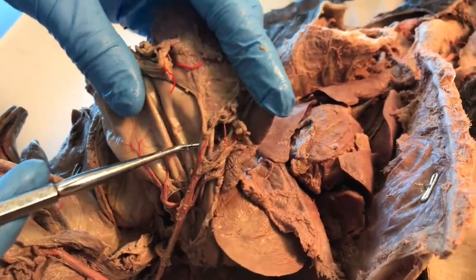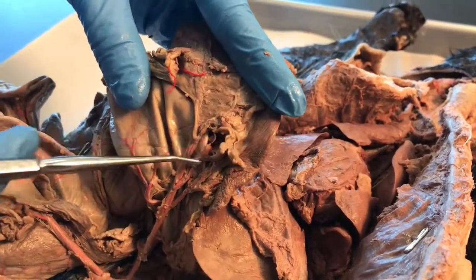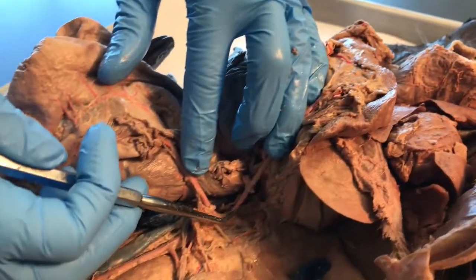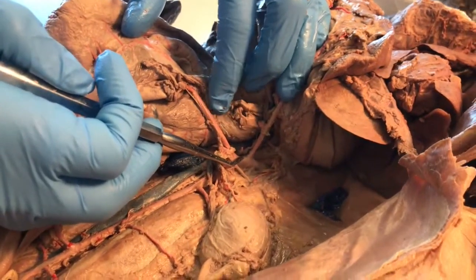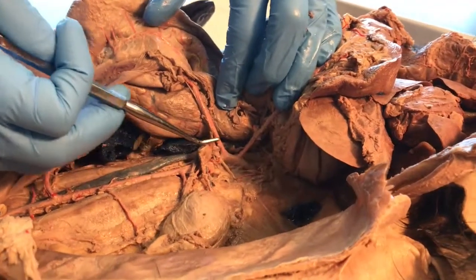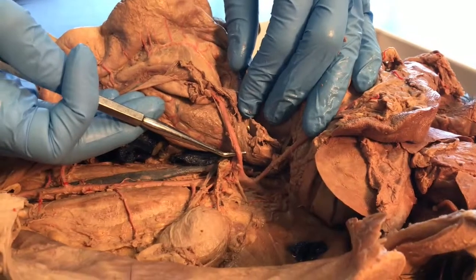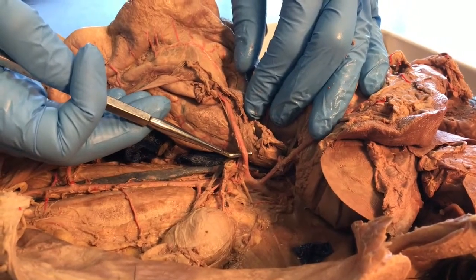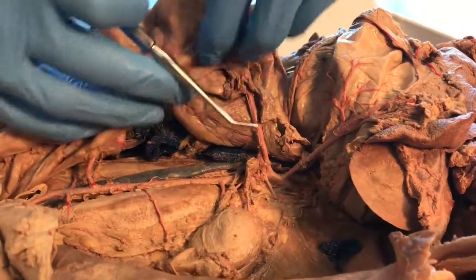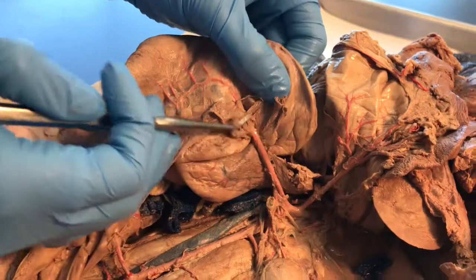Here are the splenic arteries going directly to the spleen. Let's go back down to the celiac trunk and the abdominal aorta and move further inferiorly. The next branch after the celiac trunk is the superior mesenteric artery, going to the mesentery of the intestines.